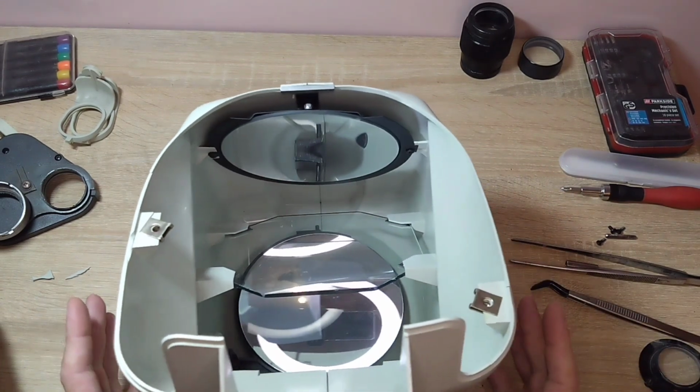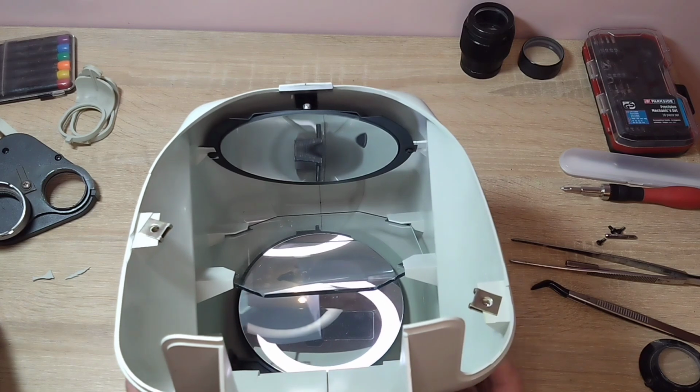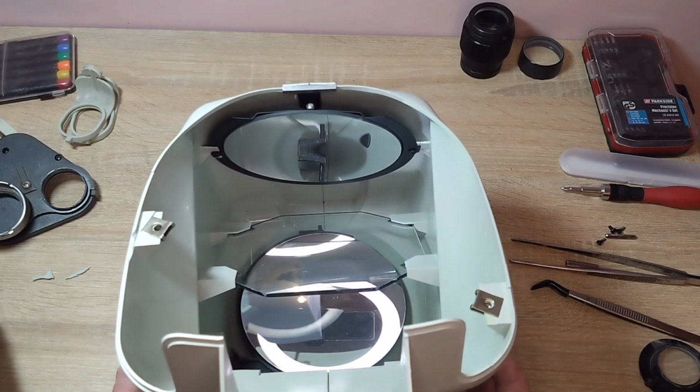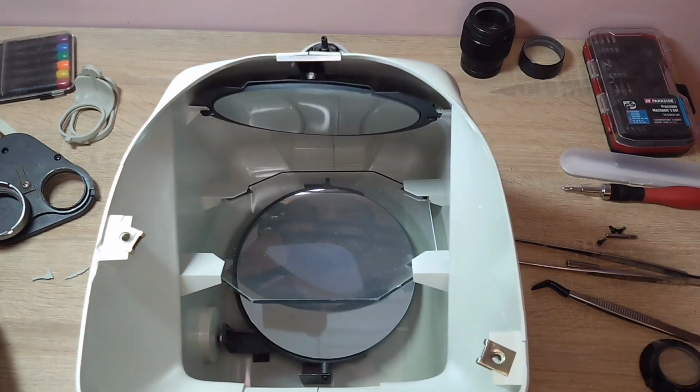In general, almost everything here is in mirrors, only 1 or 2 lenses. The owner of this microscope uses it in the production of artificial teeth. So everything here is very dusty.